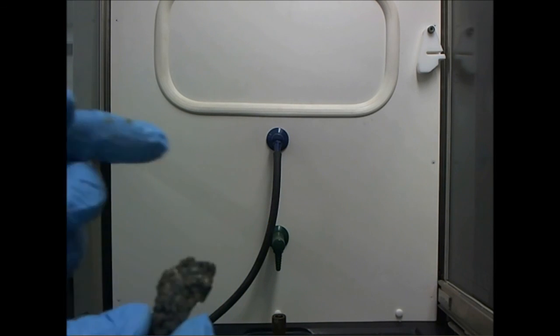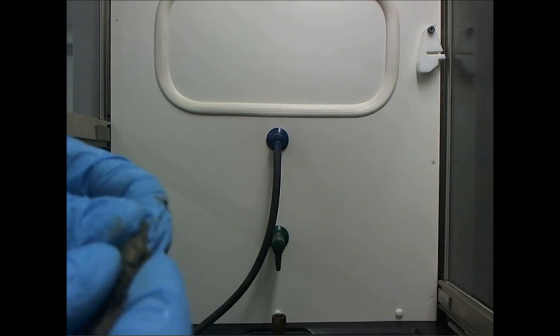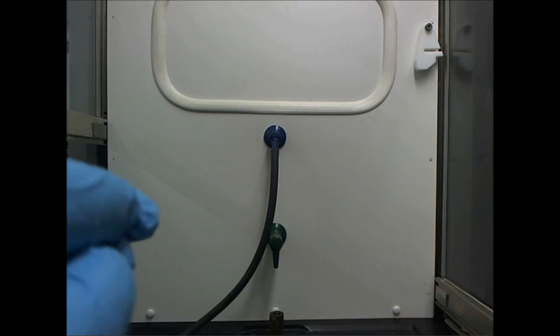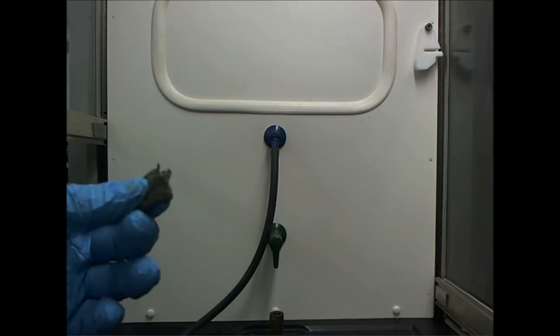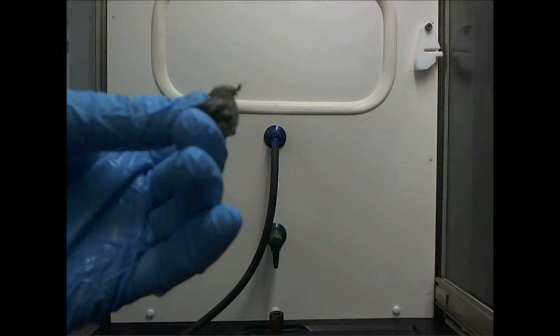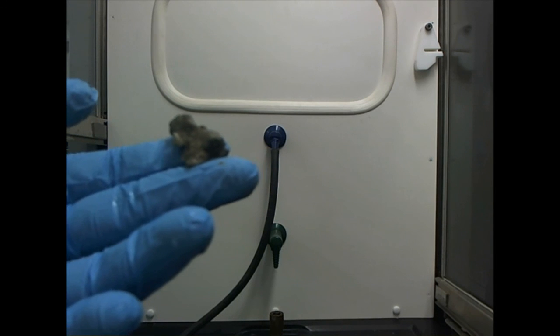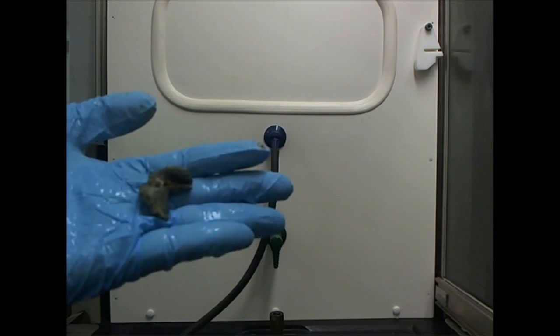And here I have my final product. This is sulfur that has now been plasticized so that it's stretchy and bendy, almost like chewing gum. The reason it's the way that it is is because I've added so much energy that I broke the sulfur rings apart to make long chains of sulfur, and now those chains have bonded together. Here I have an allotrope of sulfur known as plastic sulfur.